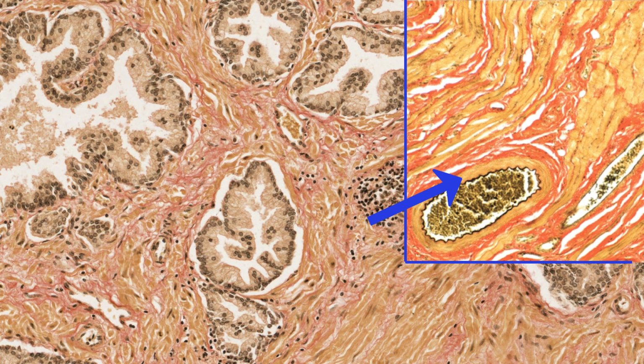But here you can see a transverse section through the wall of a small artery, again stained yellow because the wall of this artery is predominantly smooth muscle. So muscle, whether it's smooth or skeletal muscle, stains similarly. But what's important is that you can tell the difference between the muscle around the wall of this blood vessel and collagen which supports the blood vessel. And that particular collagen is showing up in that red stained component you see in this particular image.